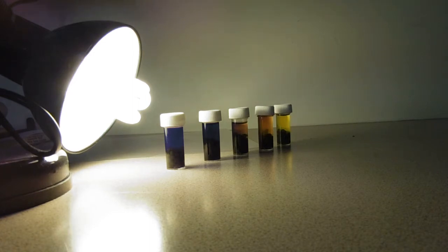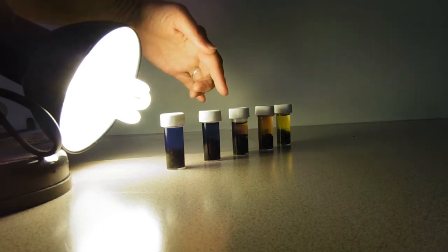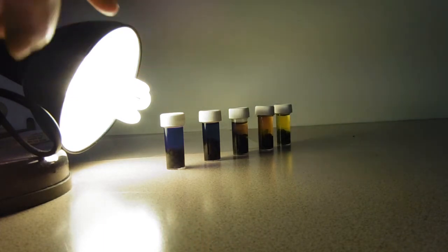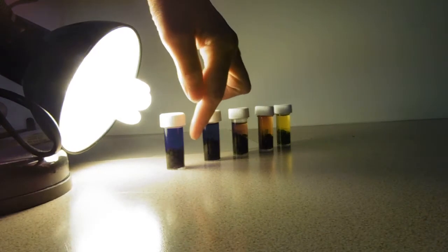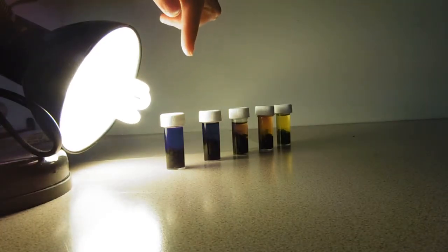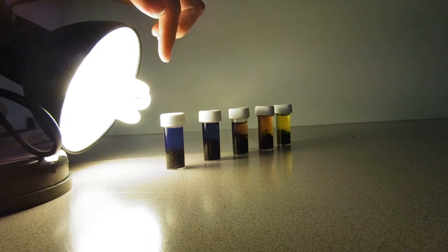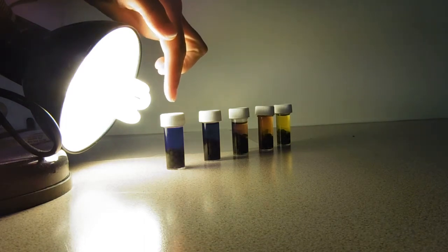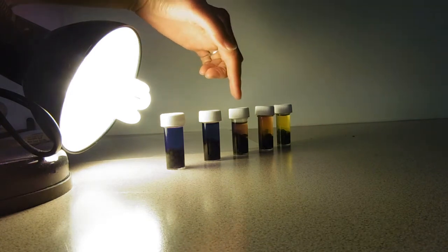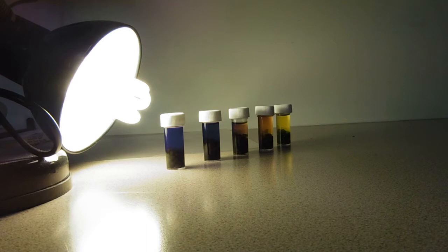What we've done is alter the light intensity by varying the distance between the algae balls in the bottom of the tubes and the light. You can see this has been running now for a couple of hours — the ones closest to the light have gone purple, and then we've got these shades of orange, and then yellow at the back.